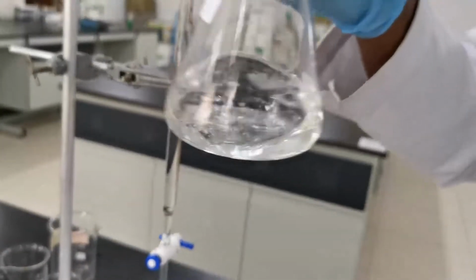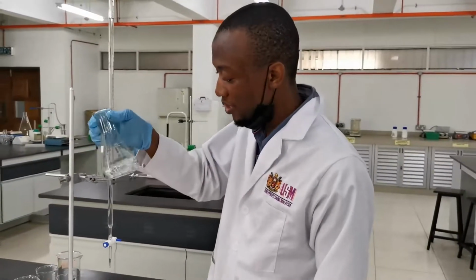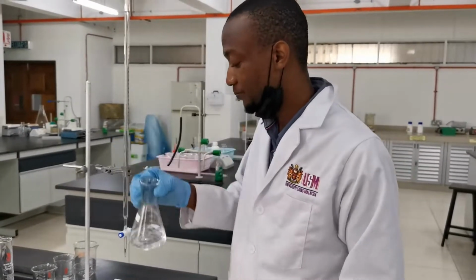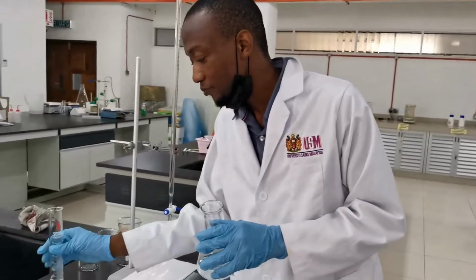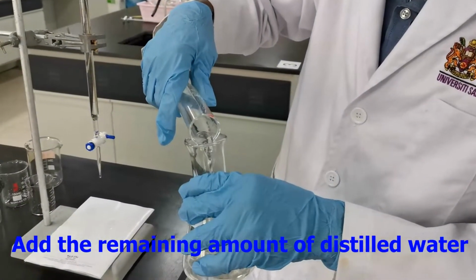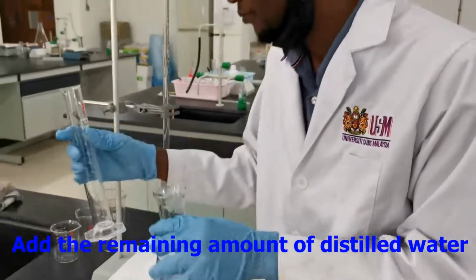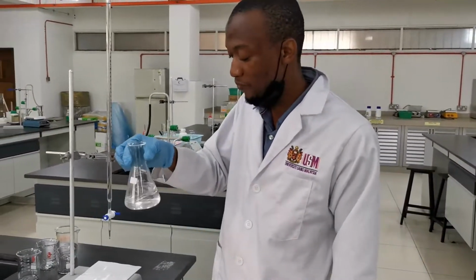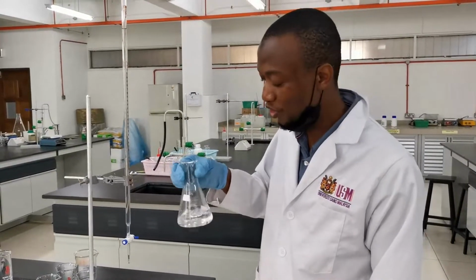So you can see I added a few volume of the distilled water into the KHP, swirling to ensure that every particle dissolves. Then you can see it dissolve. You add again the remaining distilled water, and you swirl again, swirl properly to have a homogeneous solution.